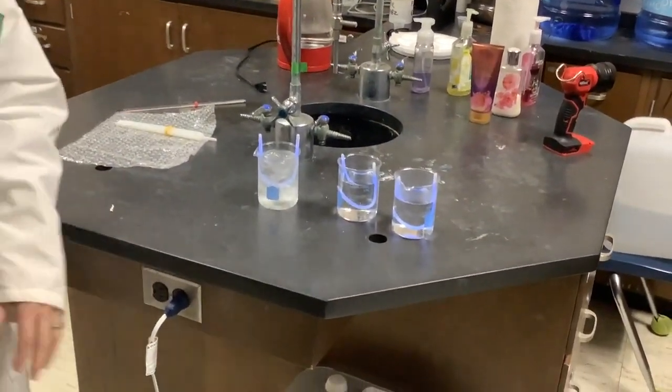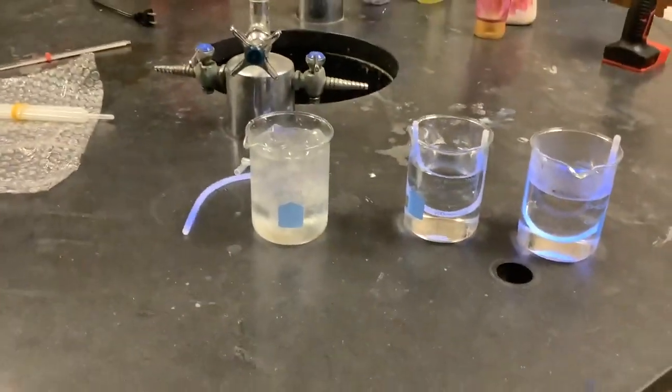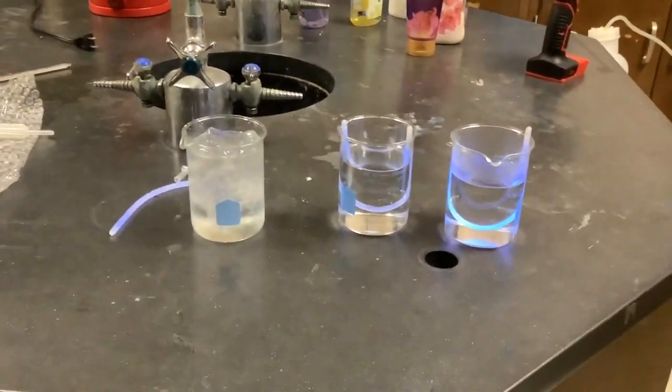This will only take 1 more minute, then we'll answer our questions. Okay. So here. That's one. Let me replace this one to the ice cold beaker. I think you can already see what effect temperature has on the chemical reaction.